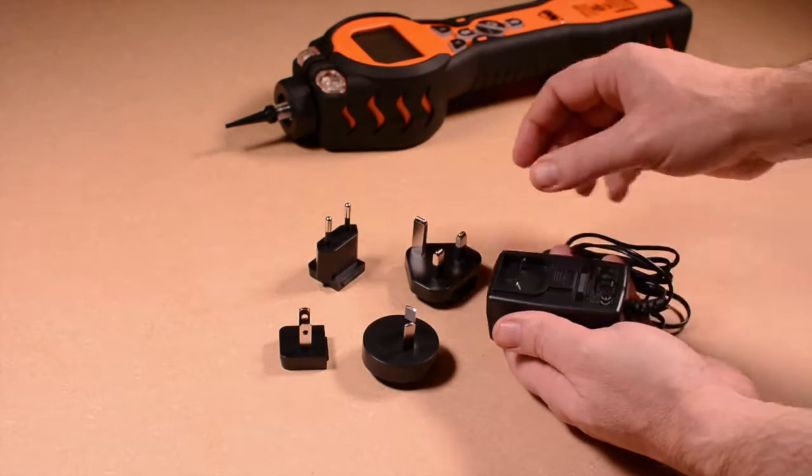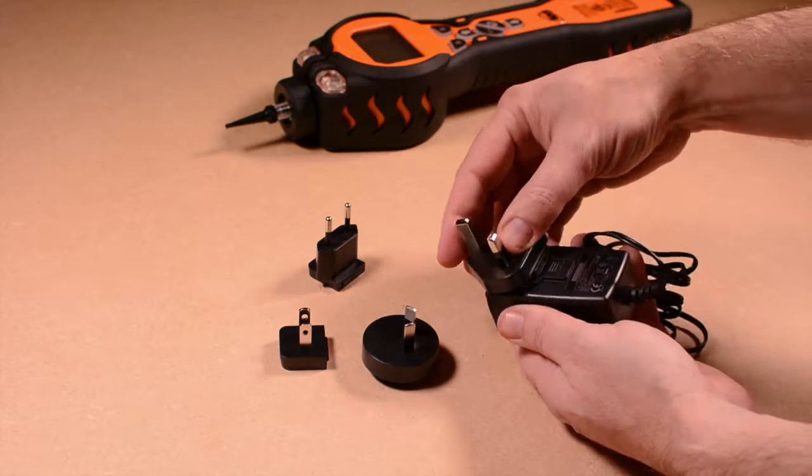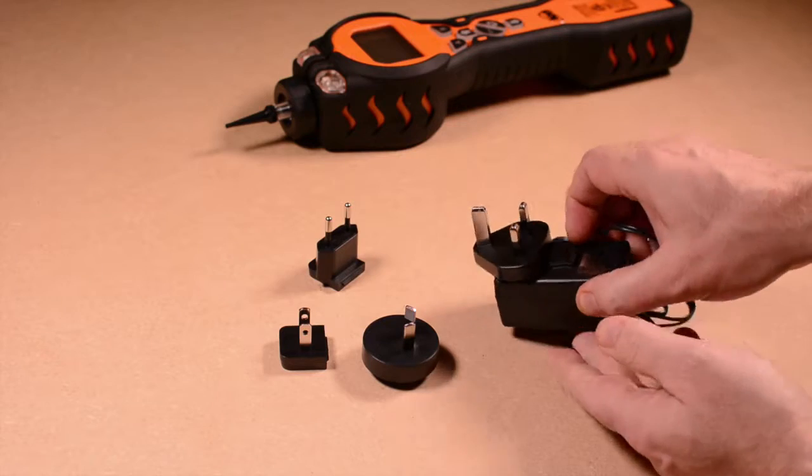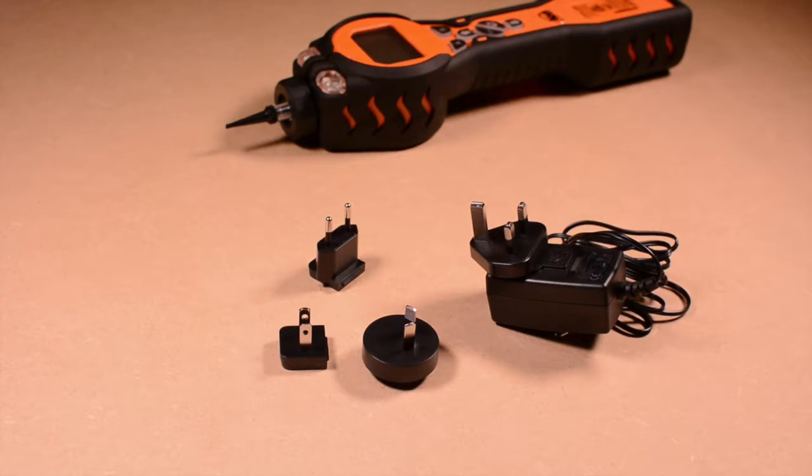Before charging your Tiger instrument, you have to assemble the power adapter. Four adapter heads are supplied, simply choose the adapter that is suitable for your country or region.